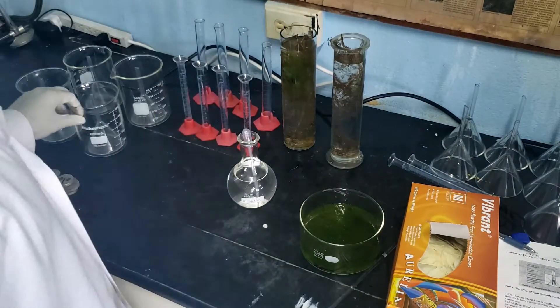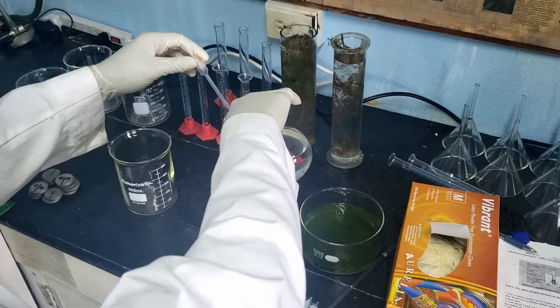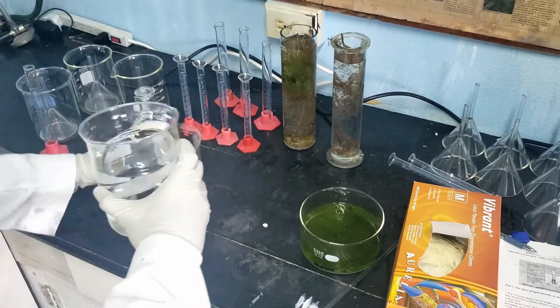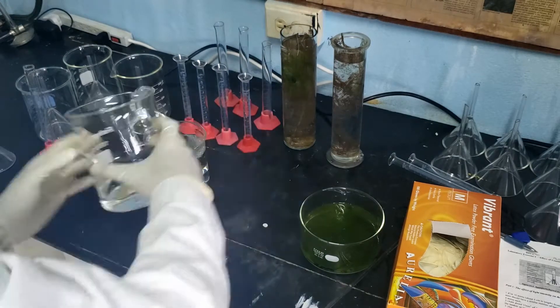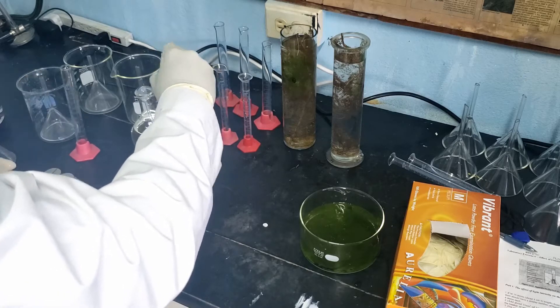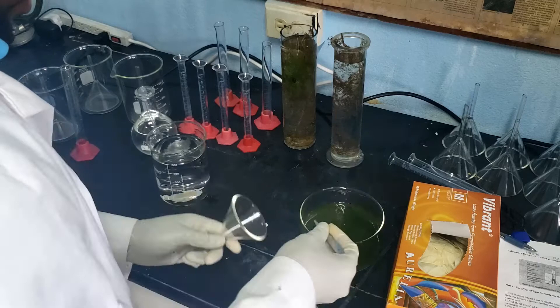Now that the leaves are ready, we can begin to set up the apparatus. First, we prepare the solution that will go inside the beaker. I'll use 500 ml of solution, so it'll take about 20 cm³ of sodium bicarbonate diluted with water. Four conditions will be tested, so this apparatus will have to be set up three other times. Once I've added water up to the 500 ml mark, I'll stir to make sure the solution is mixed well.